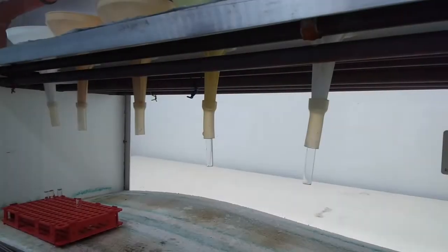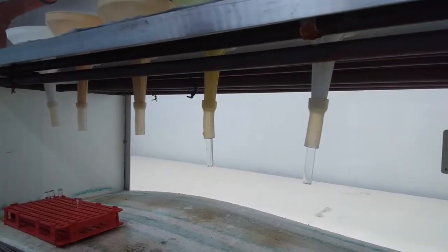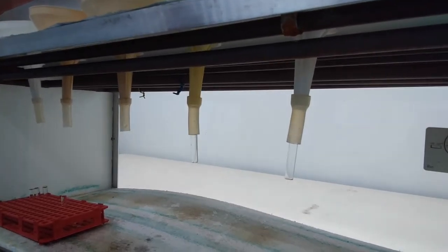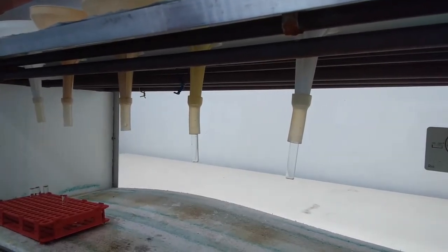The extraction is run for 72 hours at room temperature, but we need to remove extracted animals regularly every 24 hours to prevent decay and predation.